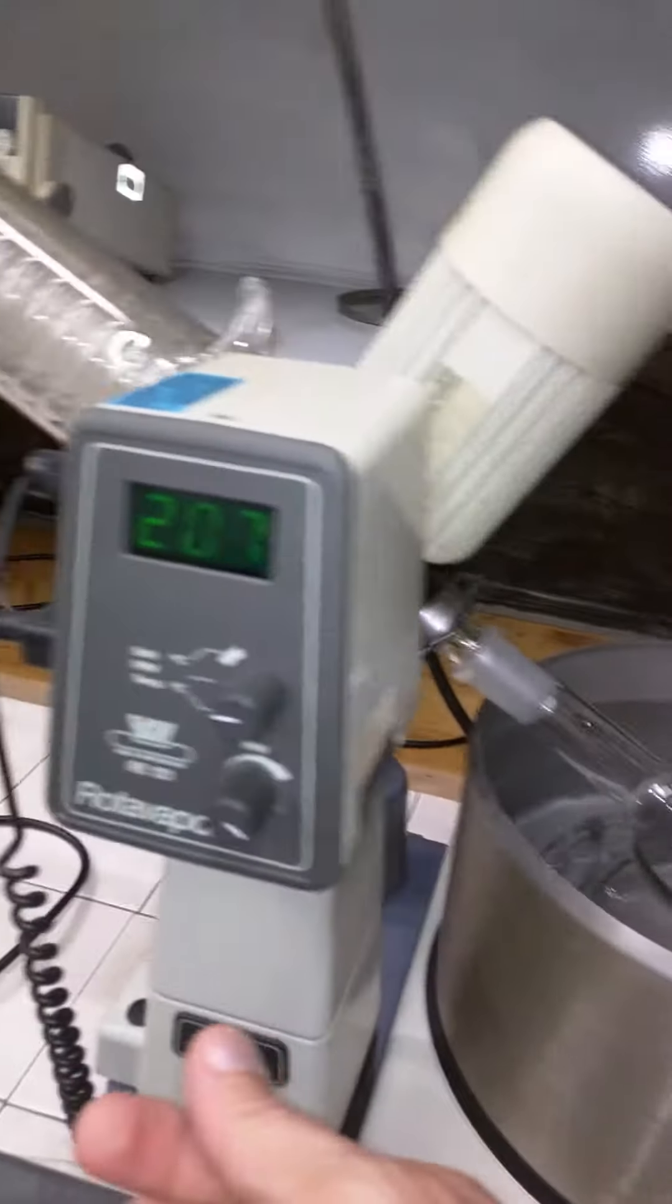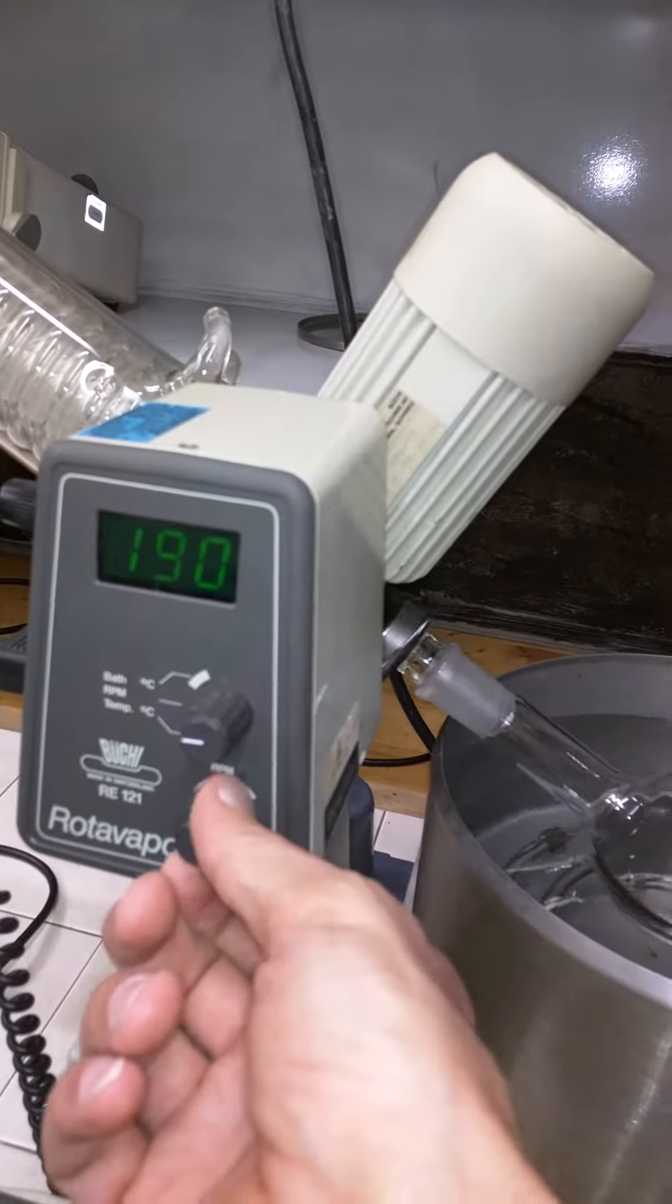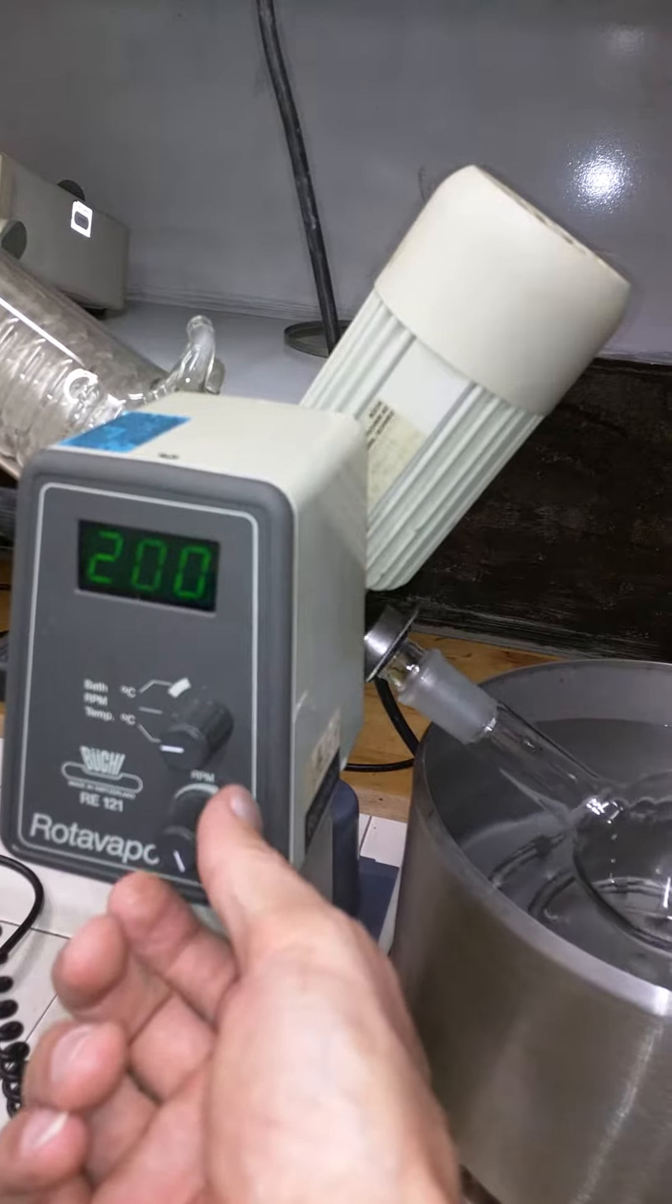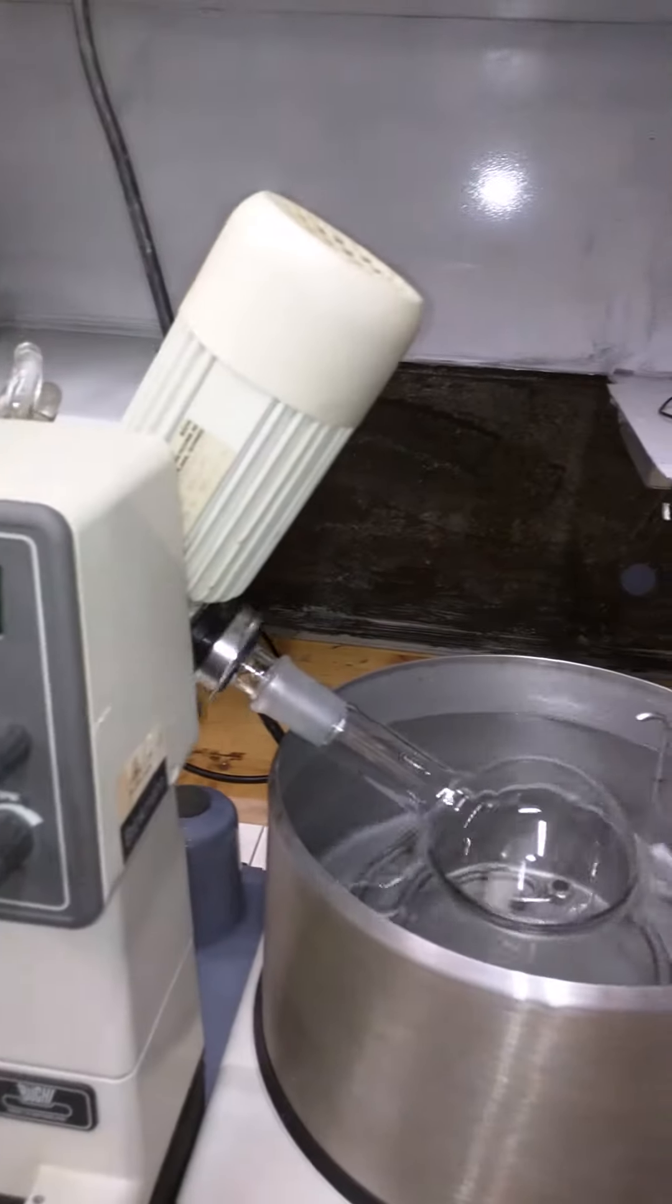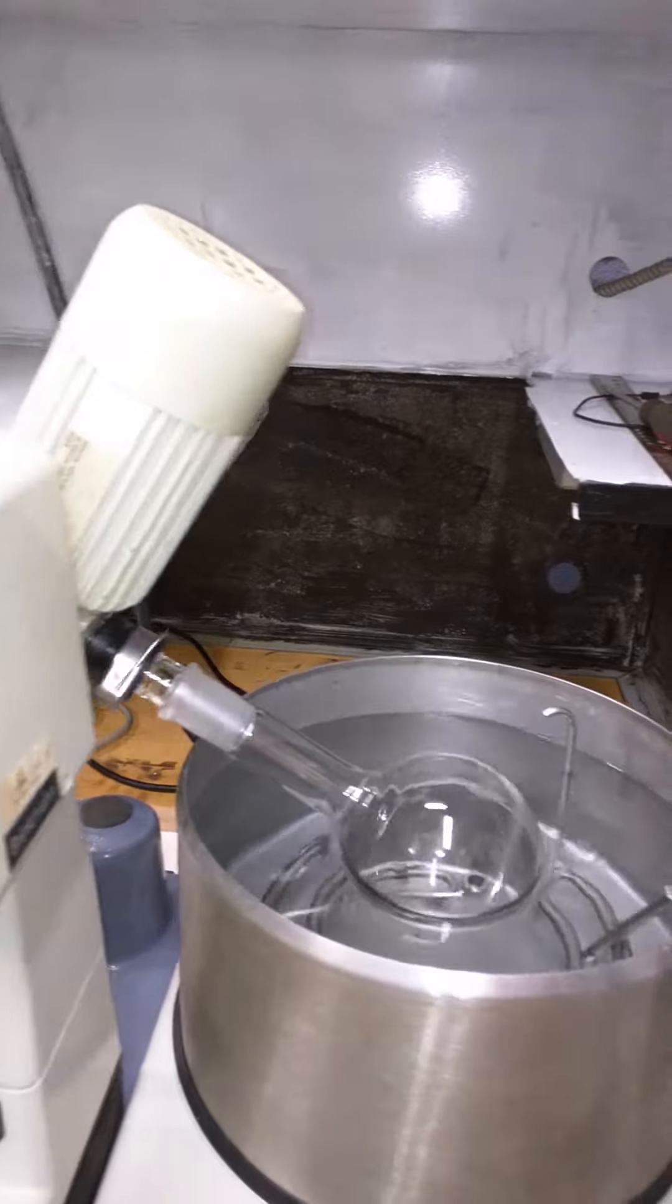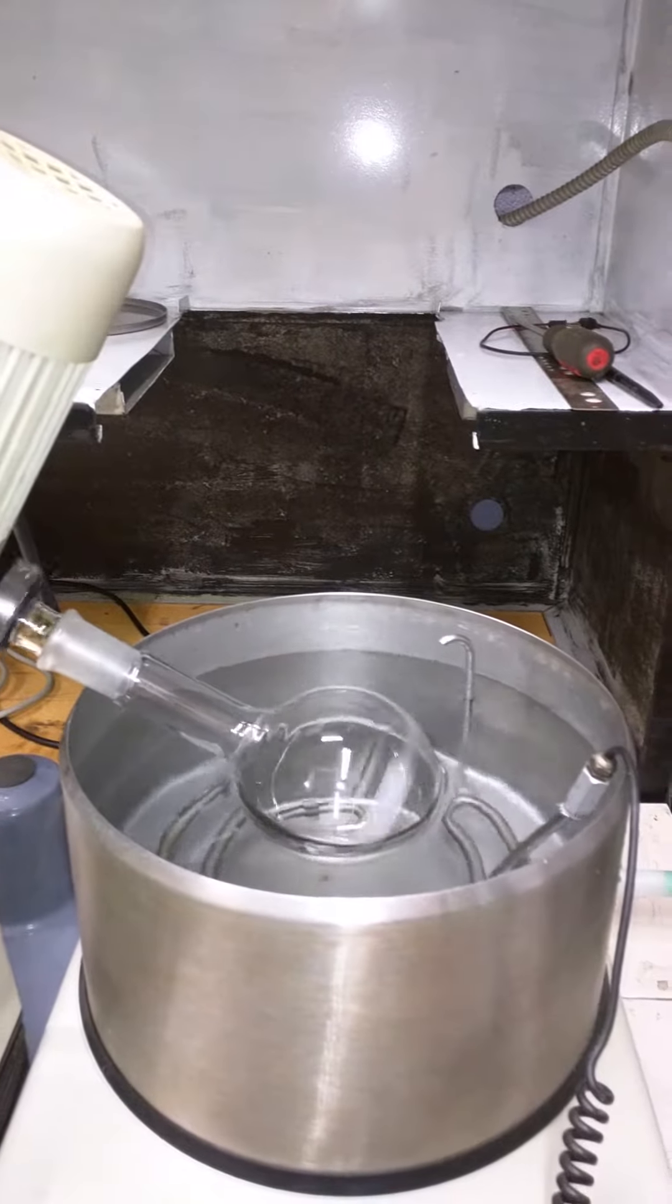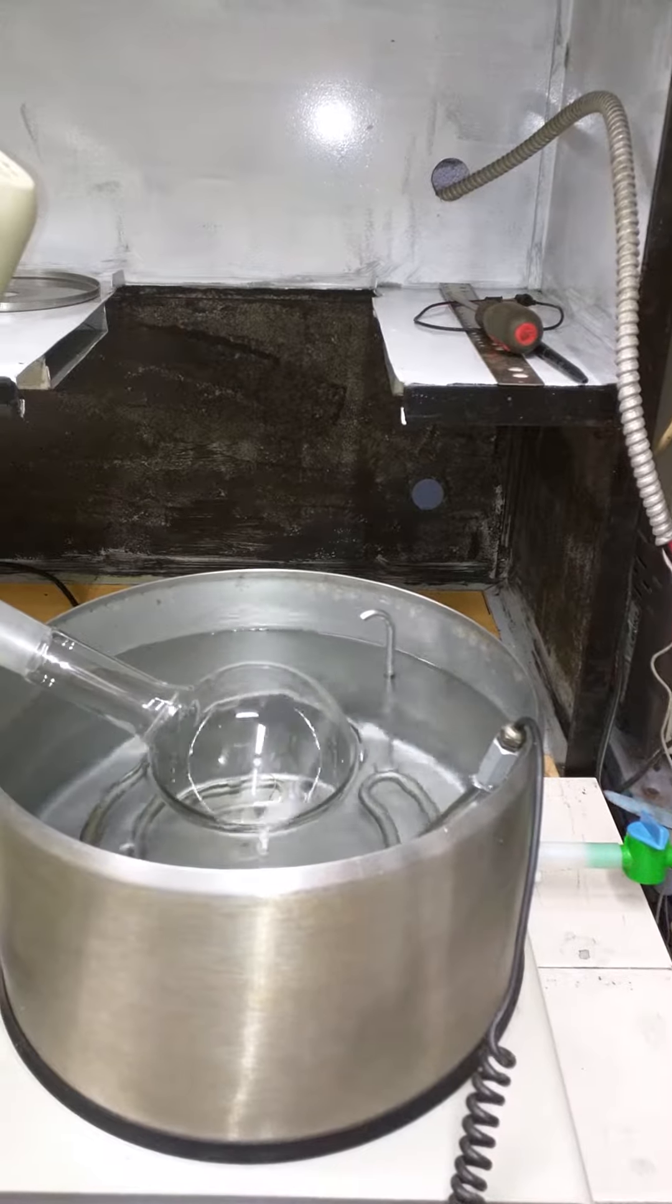We had 29 rpm, you can increase that. It says pretty much about 200 rpm, so as you see it's perfectly working.